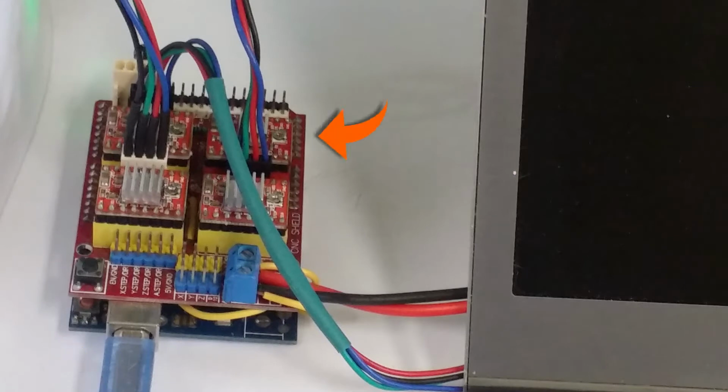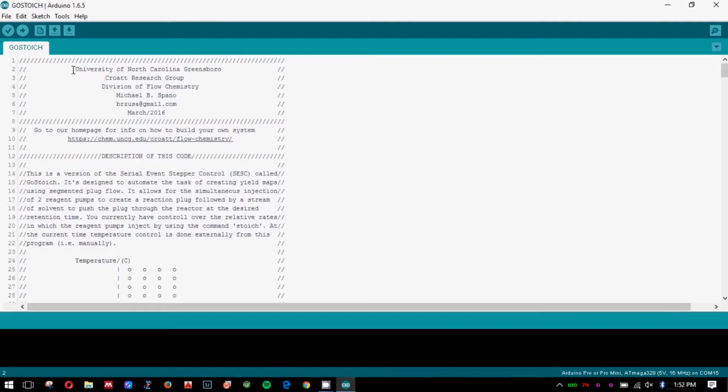I use a 3-axis CNC shield for this particular project. You can find instructions on how to make the electrical connections for a similar system at the link on the screen. Alright, let's take a look at the Arduino version of the code.